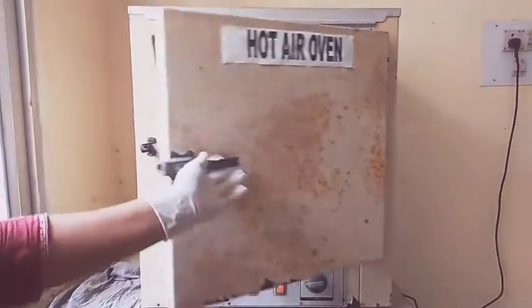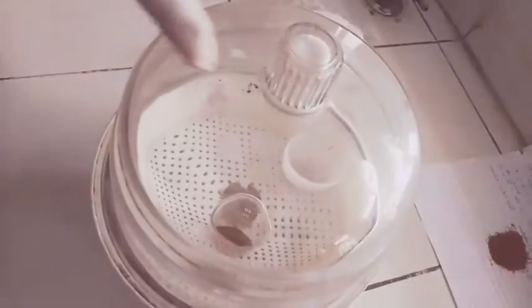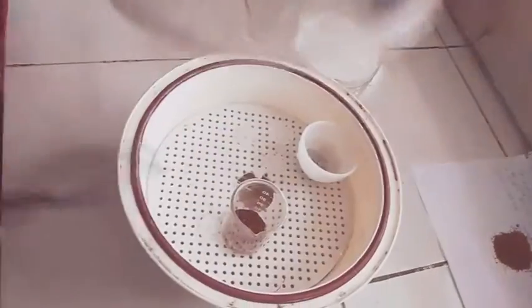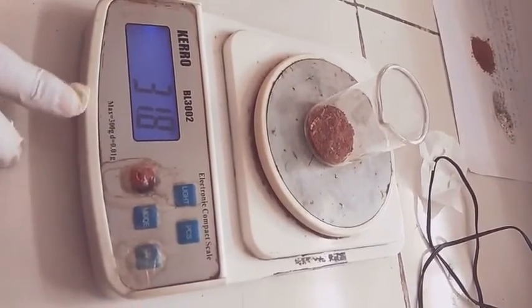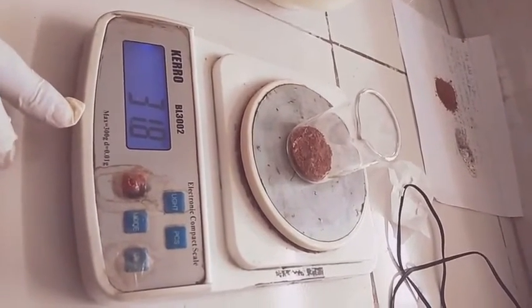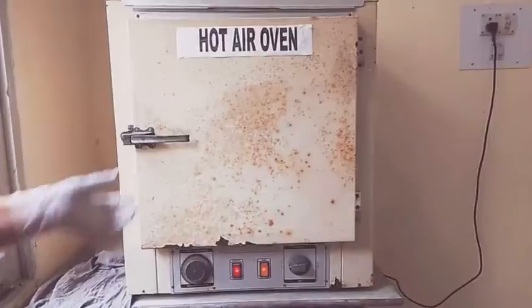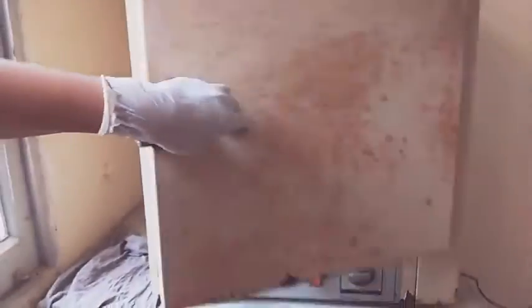Take out the drug from the hot air oven and cool it in the desiccator for 30 minutes. After 30 minutes of cooling, note down the weight — it is showing 31.8 grams. Now calculate the loss in weight of material in milligrams per gram of the air-dried powder drug. Repeat the procedure until we get a constant weight after drying.